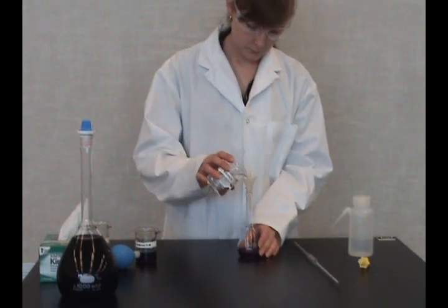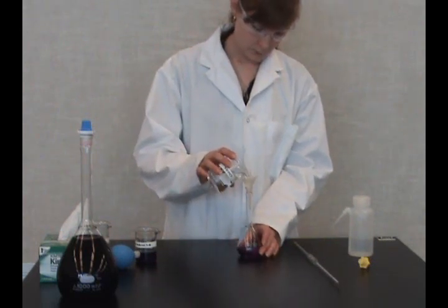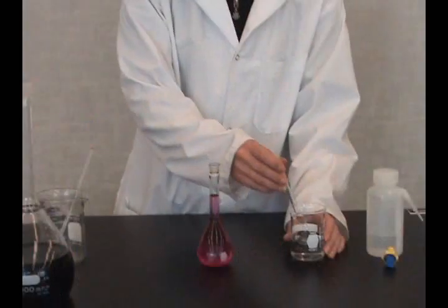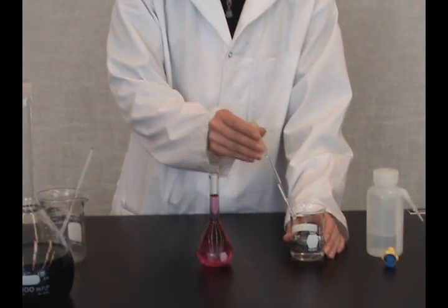With the funnel, add water and dilute the volume. Add the water drop-wise to set the meniscus.